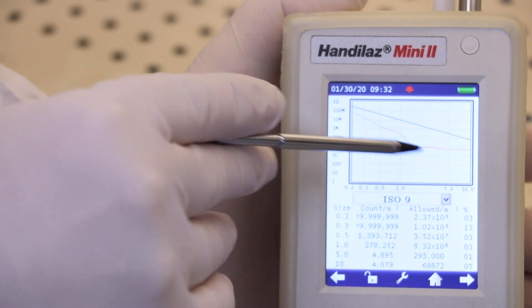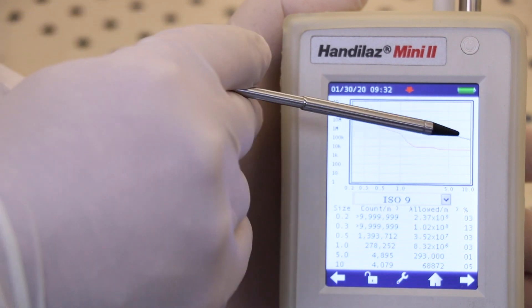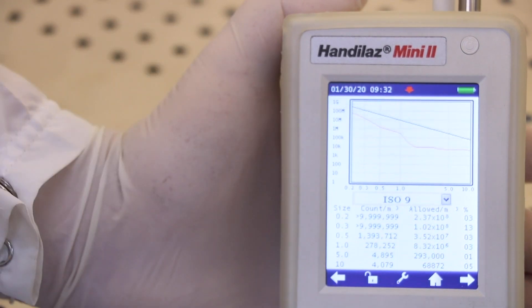Once the cycle is complete, we can see that we are well under the threshold and we can consider this an area better than ISO class 9.